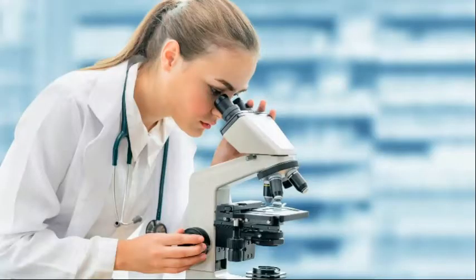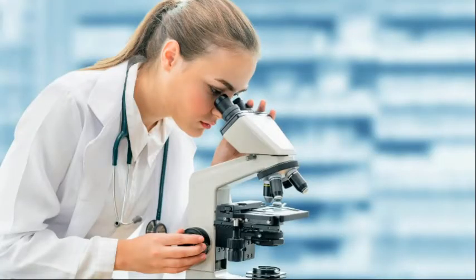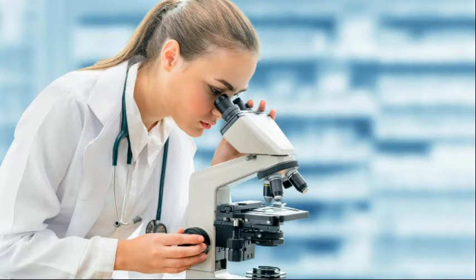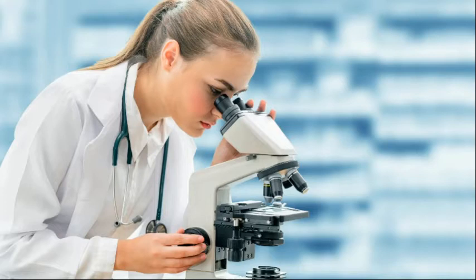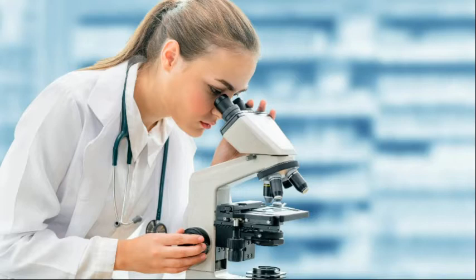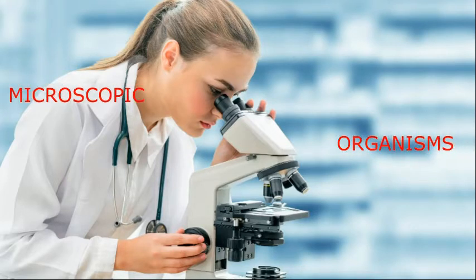The microscope is an instrument that is used in the laboratory to observe tiny structures of living organisms which cannot be seen or observed by the naked eye. Organisms which can only be seen with the aid of a microscope are called microscopic organisms.